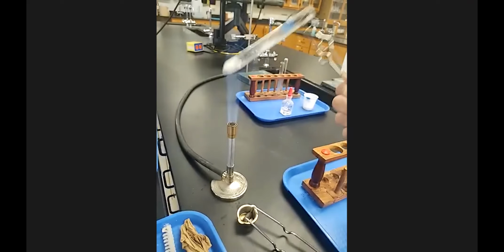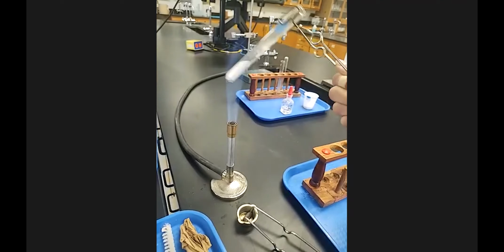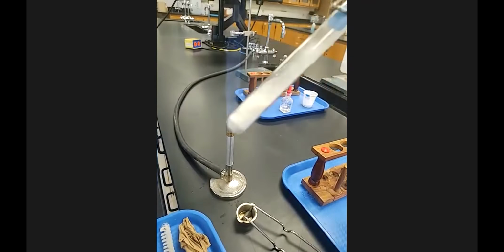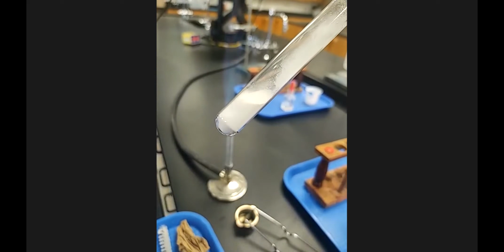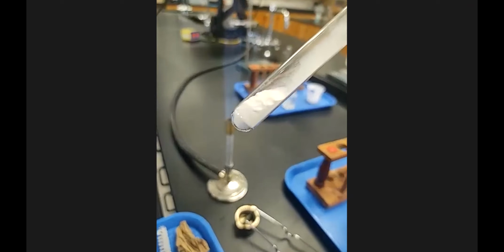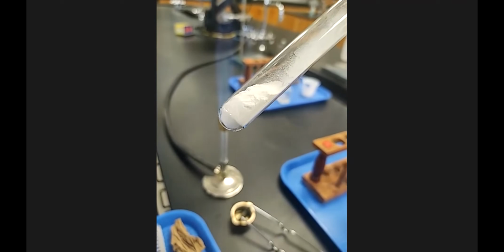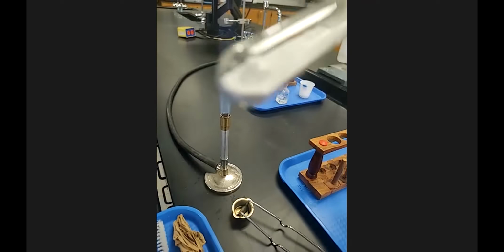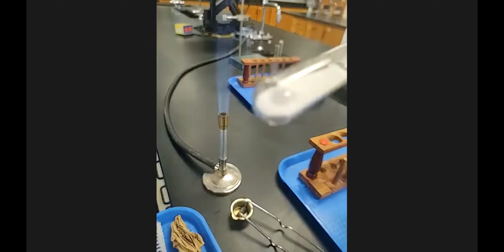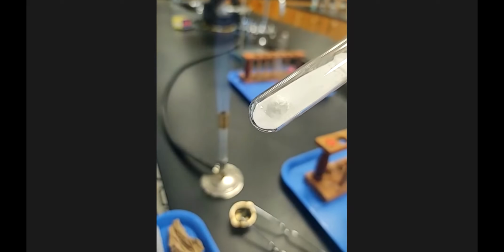I'm going to heat it again, swirl a little bit, and again, just a nice in and out of the flame. That Bunsen burner is plenty hot to get to view it. Most of the time, students miss this one because they heat it too long before they pull it out and view it. Now you see that big old chunk right there? Remember how this powder was not chunky? That is a big ball there that was not present before.